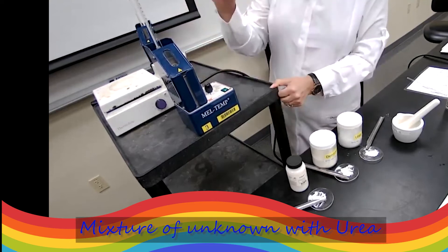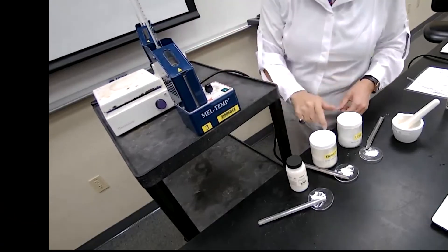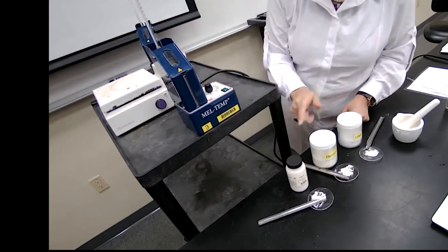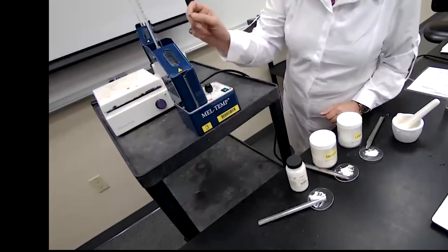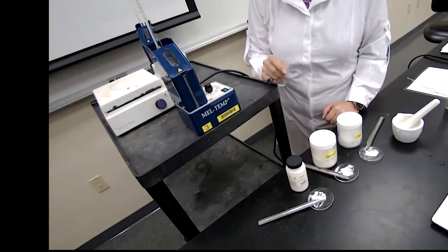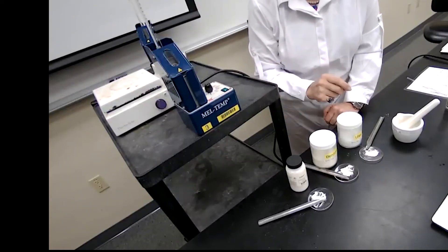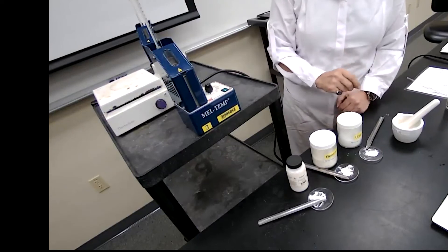So I will test each one of them separately. And I give you a still shot or clear image of the sample starting to melt and final melting temperature for you to read.